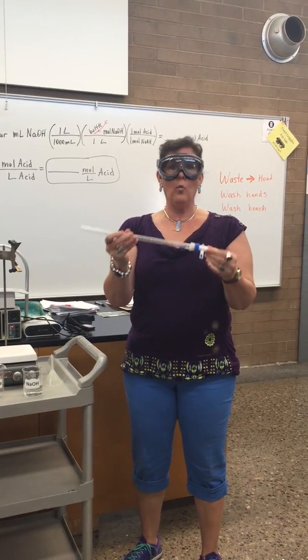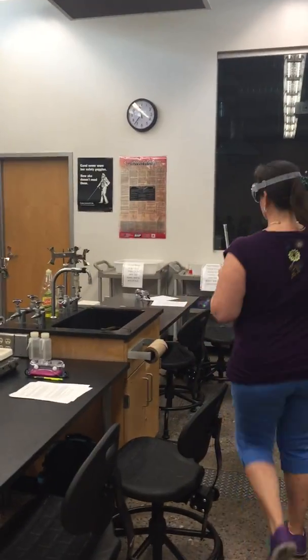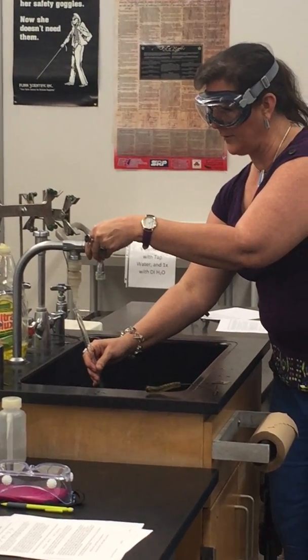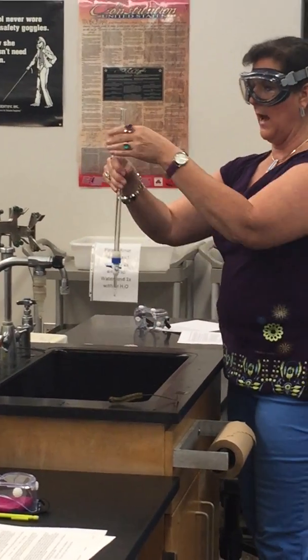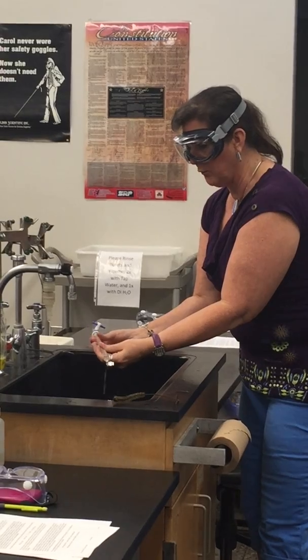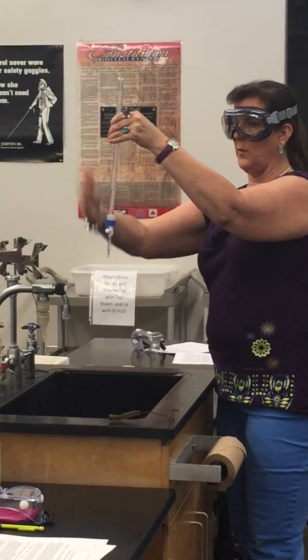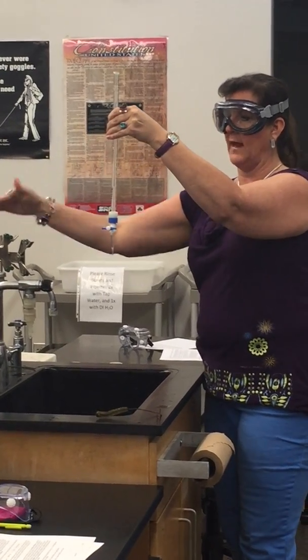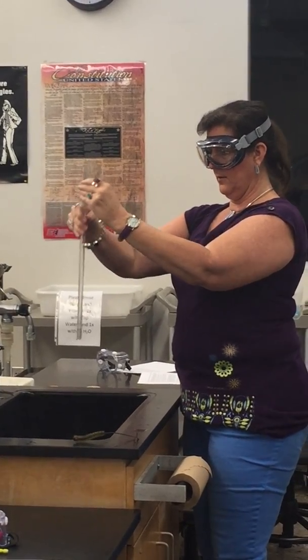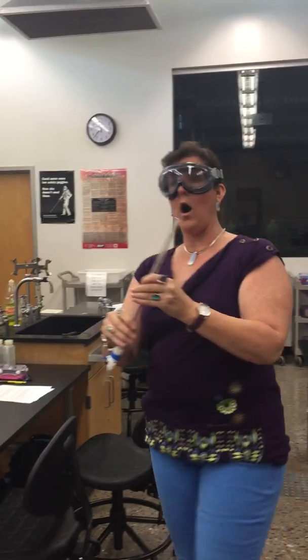We don't know what's been in this burette, so we need to rinse it with distilled water. I'm going to turn on the black knob, put a little bit of distilled water in my burette — I don't need to fill it all the way up. I'm going to turn it sideways and roll it around, let the inside coat with the water. I'm going to open it up, let it come out the tip. When it's vertical, it's open; when it's sideways, it's closed. I'm going to turn it upside down and let the rest of the water come out. Now the inside of my burette is coated with distilled water.